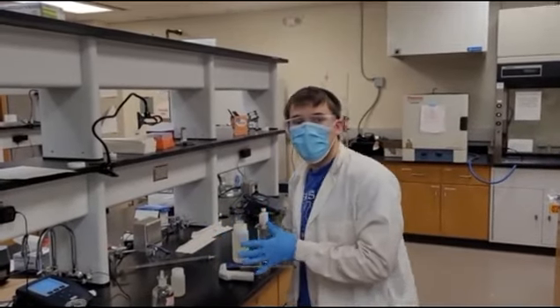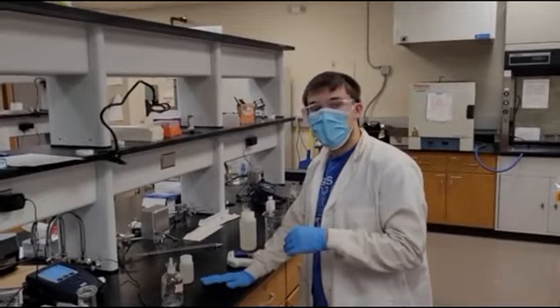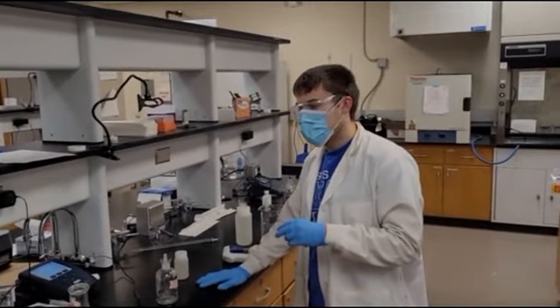Welcome to Lab 3. We'll be doing the demonstration of BOD and COD tests.